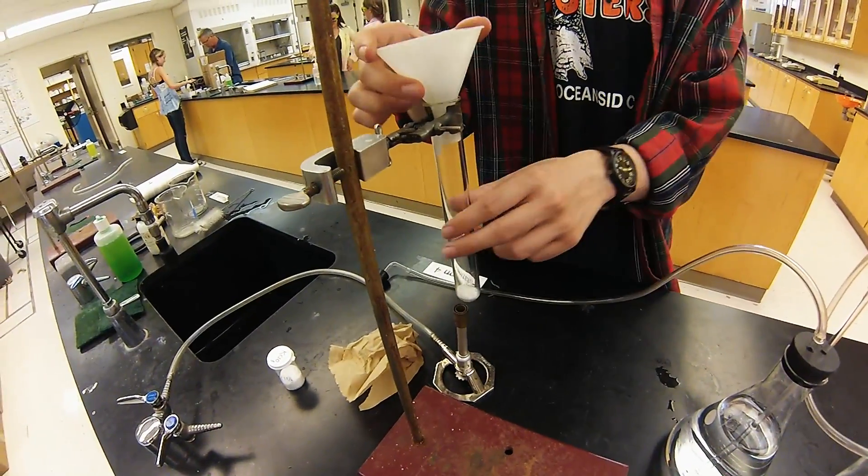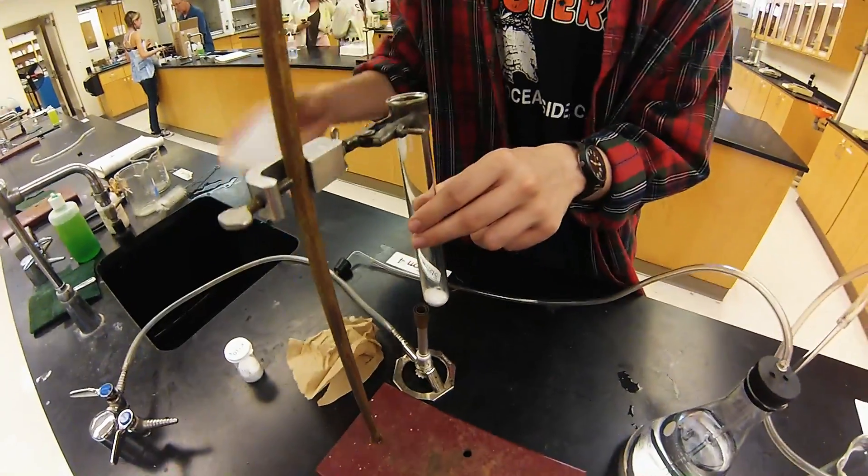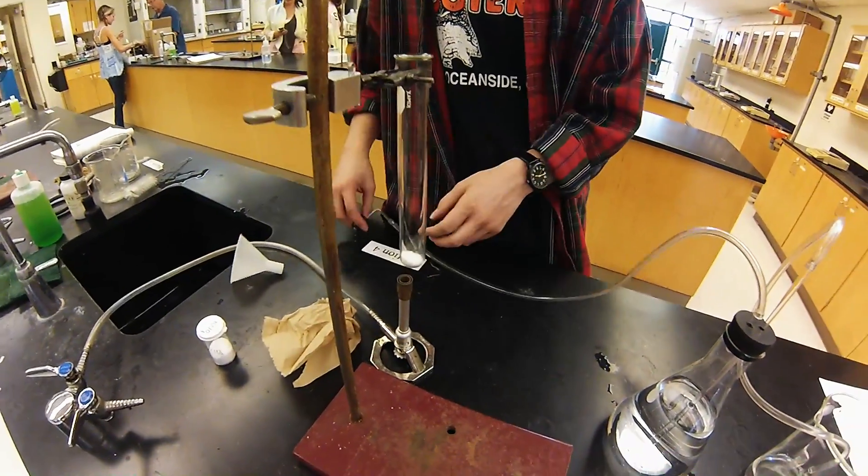And that's in there. Make sure you have all the powder in by shaking it out a bit. And now we're ready.